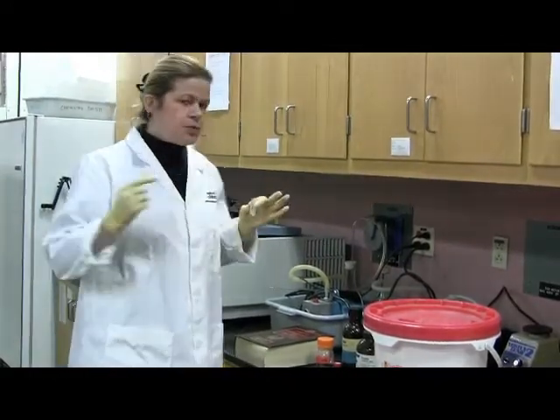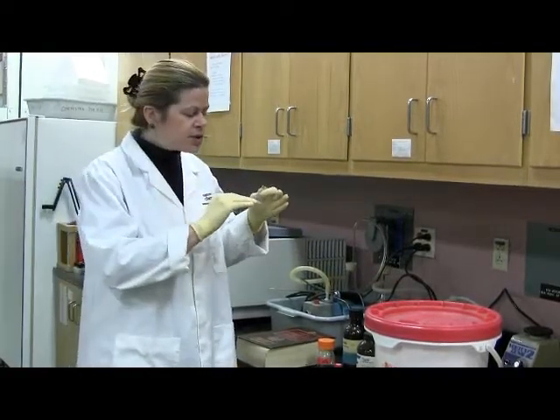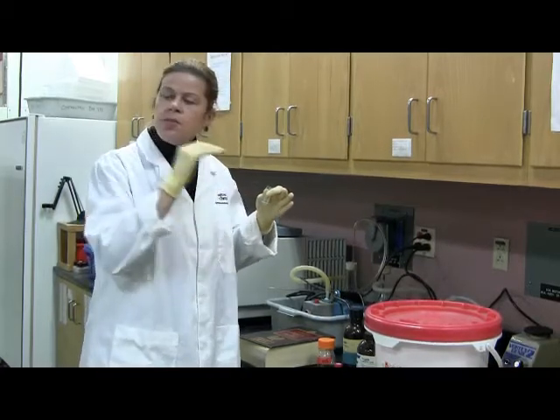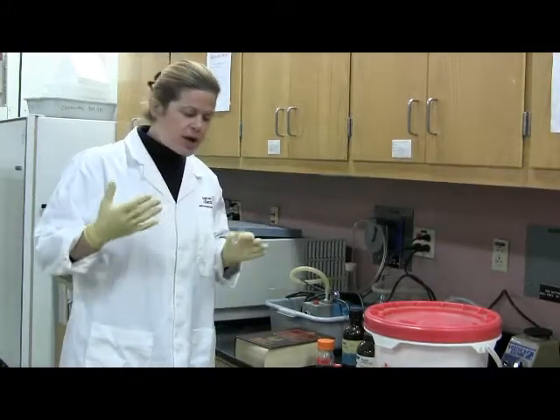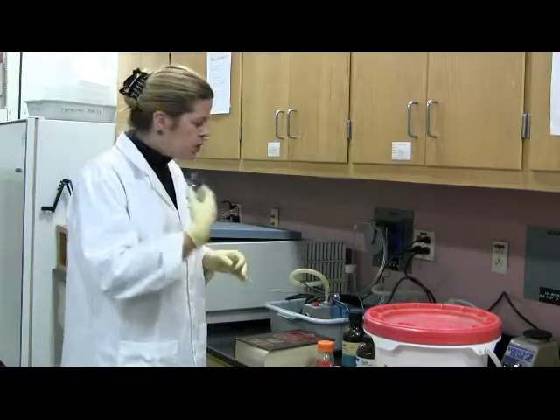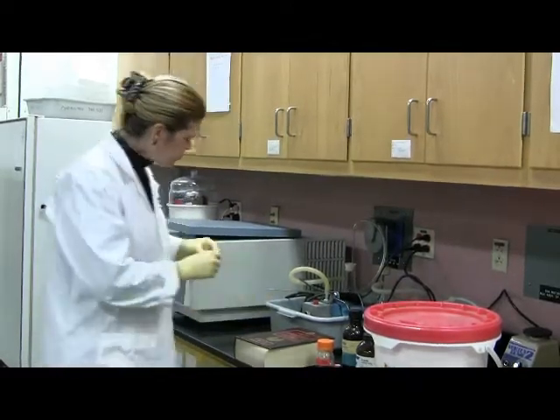So read that procedure carefully and understand how you are supposed to prepare your cuvettes with buffer, with some substrate, and when that's ready to go, then you put in the trypsin and you measure the kinetics right away. So this is a team project. You do this together in a team. Identify who's going to be the one responsible for assembling the cuvettes, who's going to be the one responsible for measuring the enzyme kinetics, and all that sort of thing.